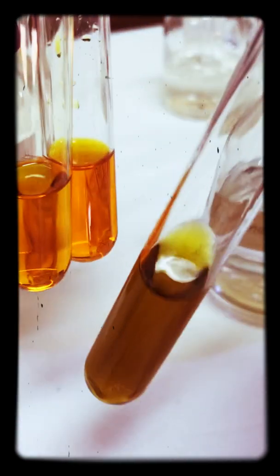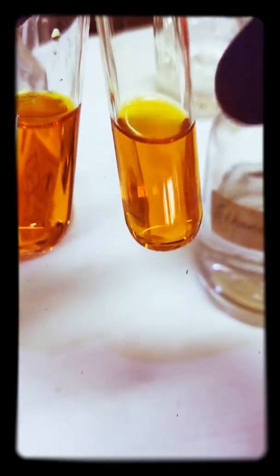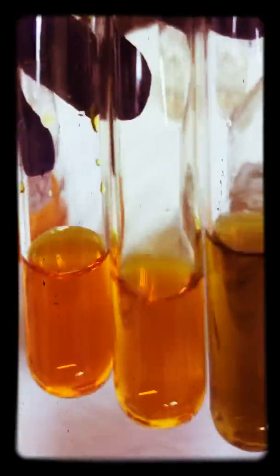This was done ten minutes ago. So this is the original on the left hand side, this is what I've just made, and this is after ten minutes.